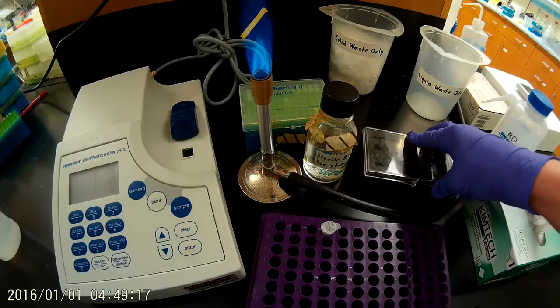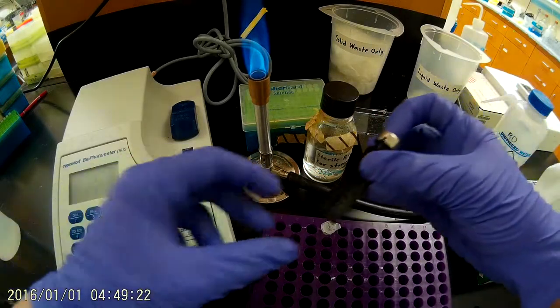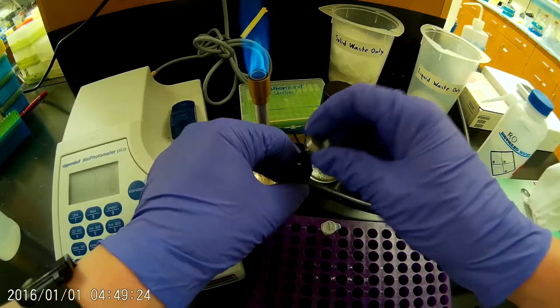So first we're going to begin by cleaning off our tray cell cuvette, which we've got here. You want to be very careful with that because it's extremely expensive so you don't want to drop it or knock it over.